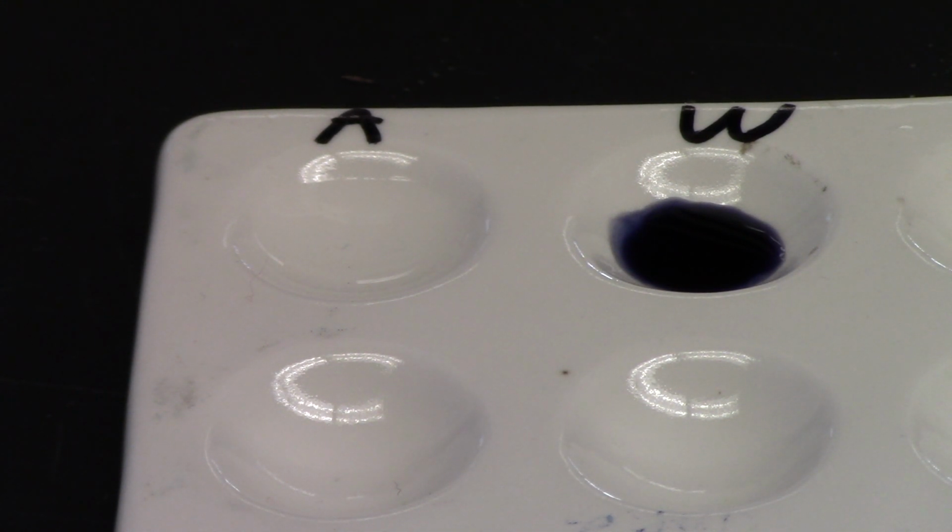Now think about that in terms of food and digestion. When you eat food such as potato chips, for example, potato chips are full of starch. And when you eat them, they go into your stomach, which is filled with acid. And the starch gets digested in the acid, which is kind of what we're mimicking here, just so we're all on the same page. All right, so that's the starch iodine test.